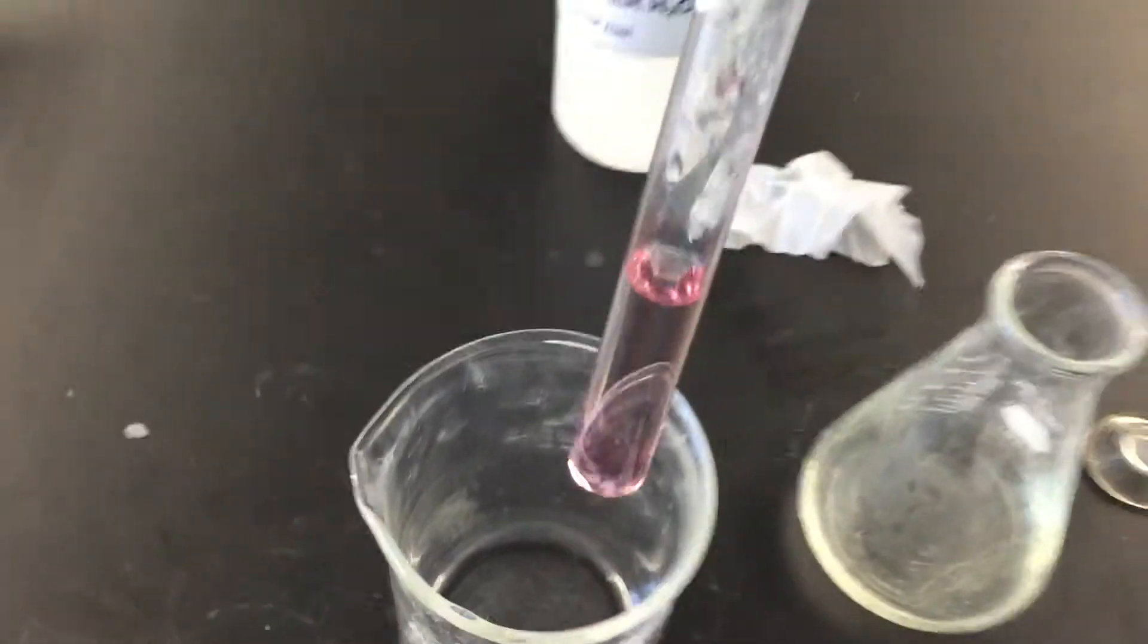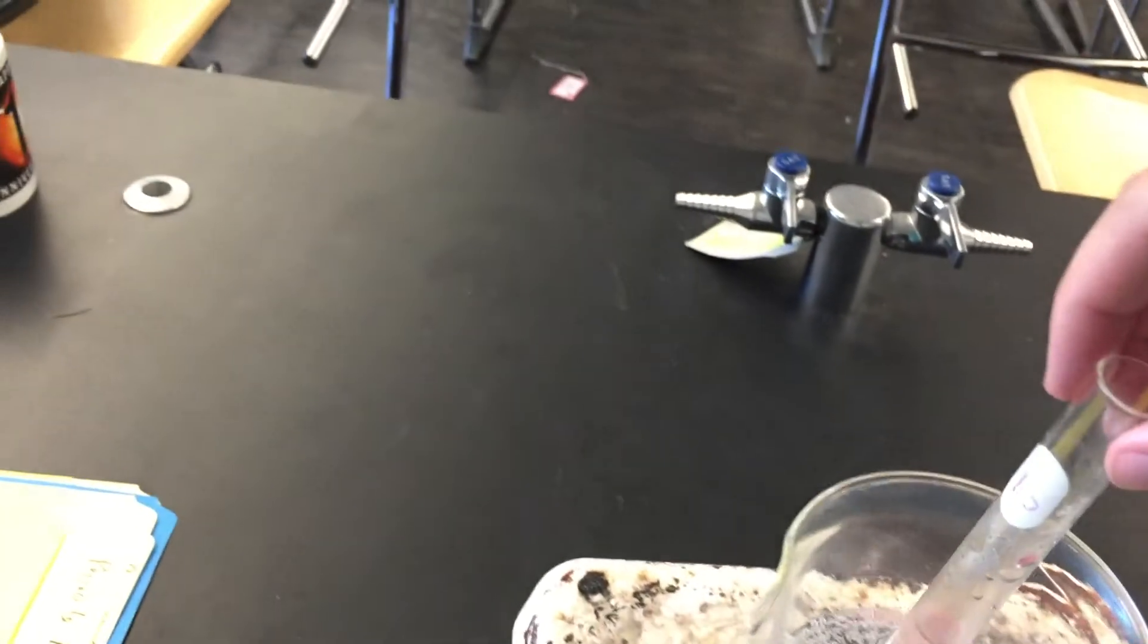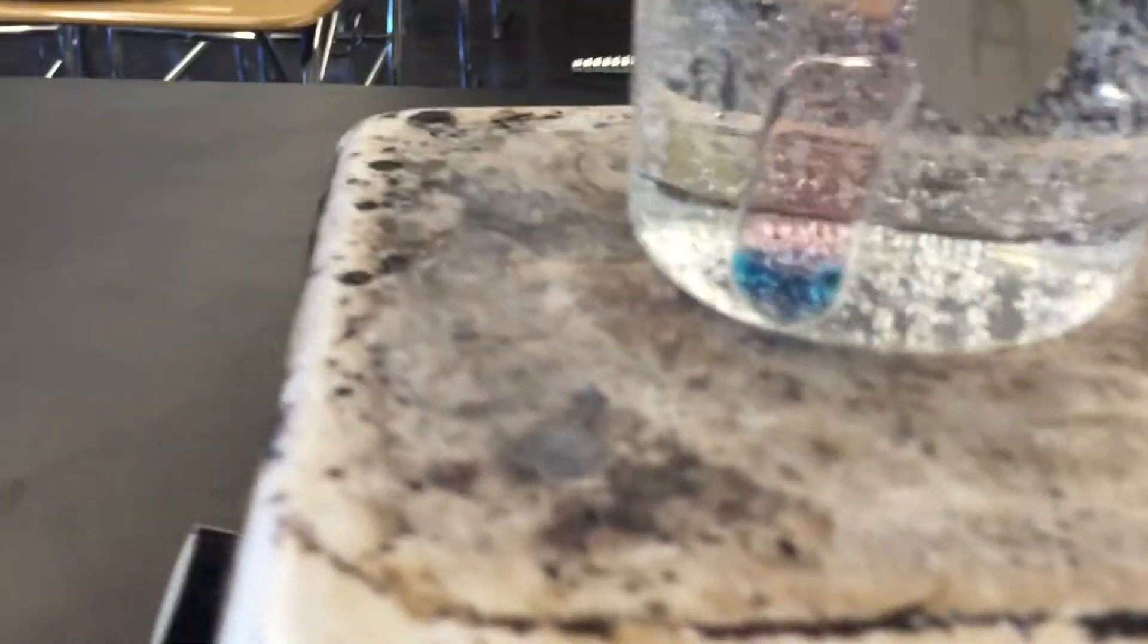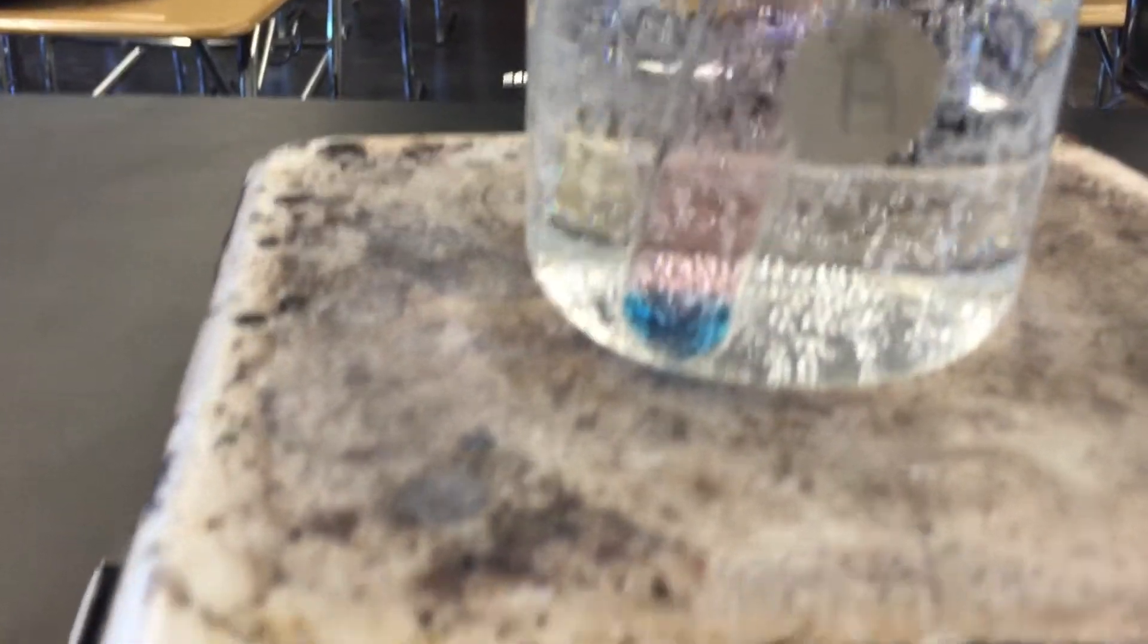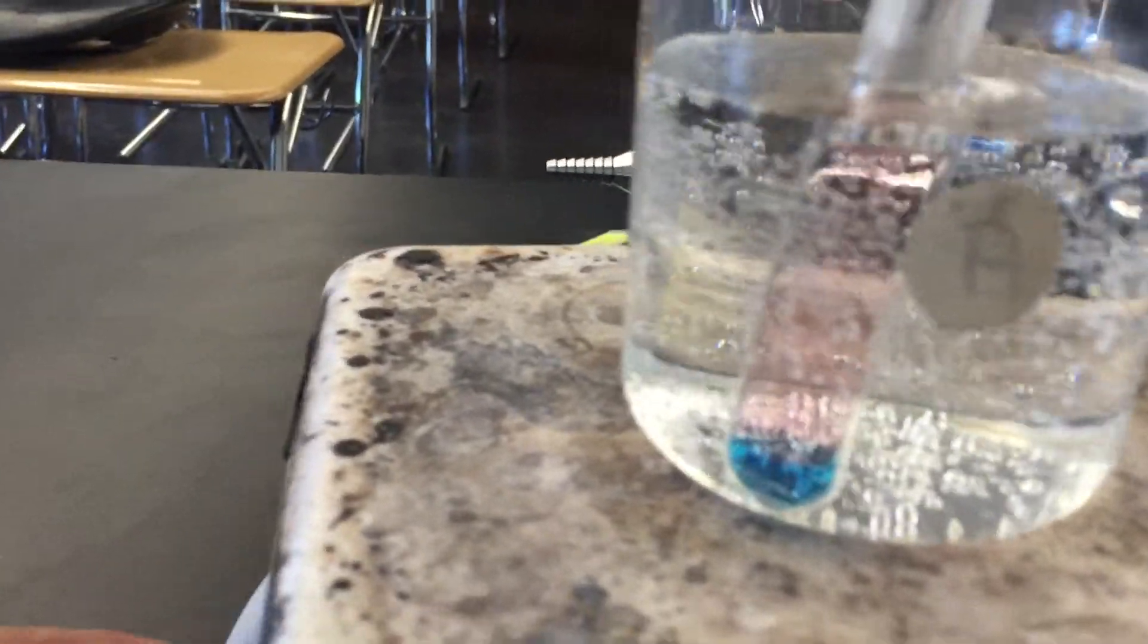If this color change isn't as dramatic as I want it to be, I might use a different mixture. Here I go. You can see it right now, because it's on direct heat, it's turning to a beautiful shade of blue. It looks like my complex was correct.